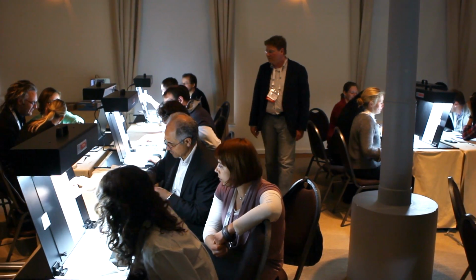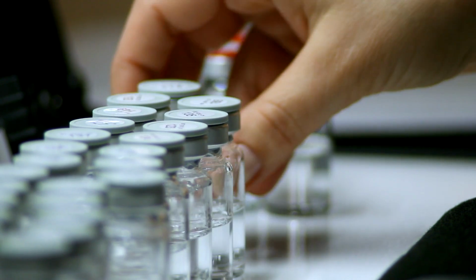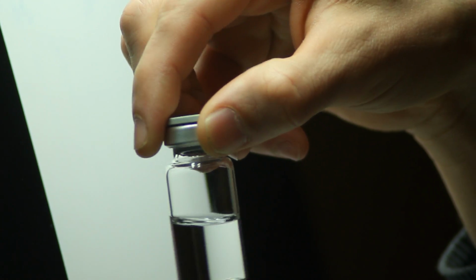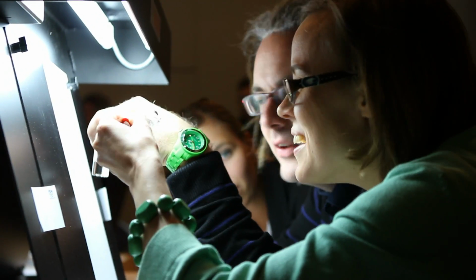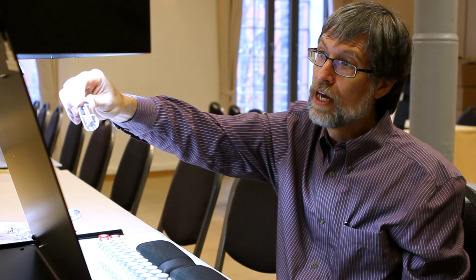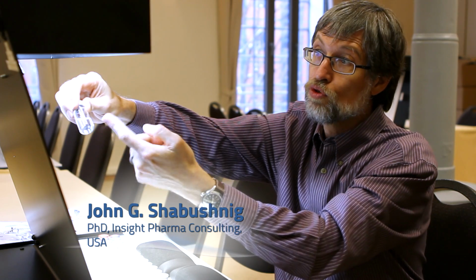So what we are doing is a standard particle inspection. We're looking for particles in the vials, and some of these vials are blank with no particles. Some of them we have put glass particles or plastic particles or fibers in, in order to show the students what these kinds of particles will look like under this standard inspection condition. So we have a diffuse light coming from above, and then we move the vial so that we get particles to move against the background, which makes them easier to see.